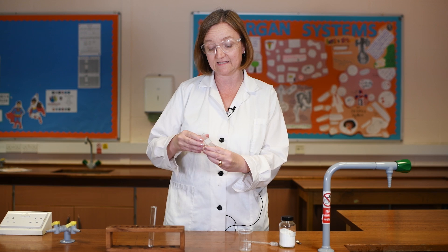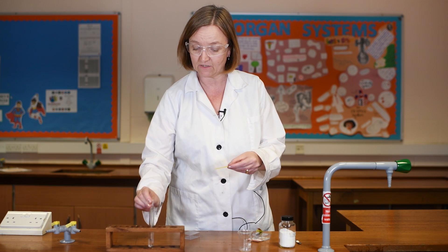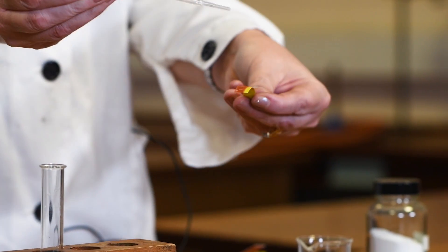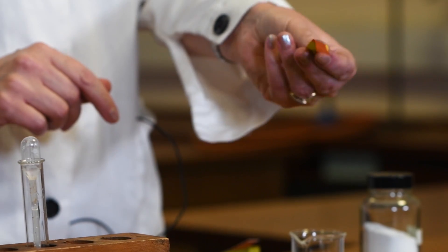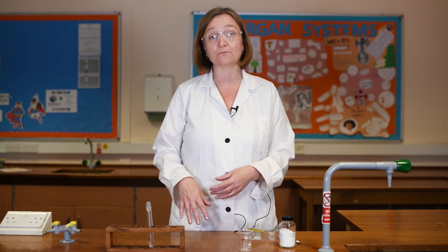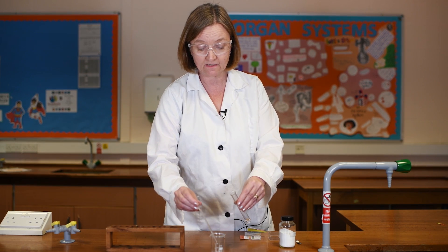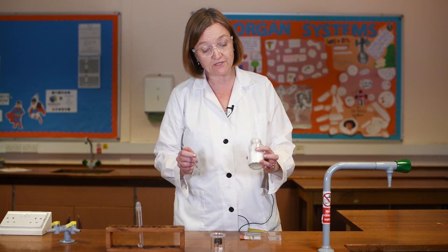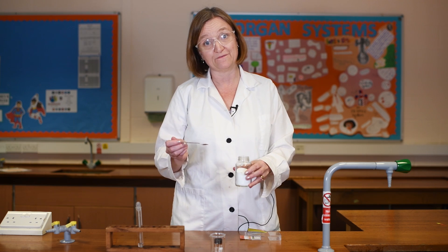We can do two slightly more chemical tests as well. The first is to use some universal indicator paper — taking a small piece, I'm going to take a drop of my distillate and carefully squeeze it onto the paper. Straight away you can see that strong red colour indicating a very low pH, so that's definitely not ethanol — that's definitely an acid. My final test, which is a general test for an acid, is to add some to a beaker and then add sodium carbonate. Just like any acid, ethanoic acid will fizz with sodium carbonate — you can use solid as I'm doing here or a solution — and as the carbonate and acid react together they release carbon dioxide gas.